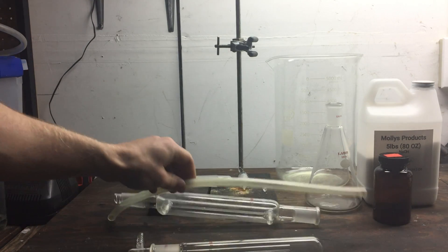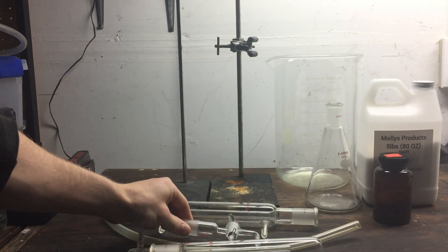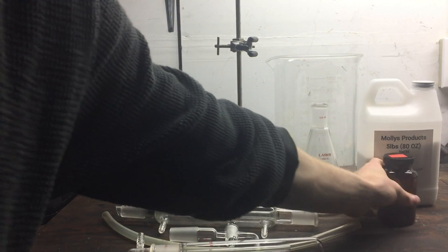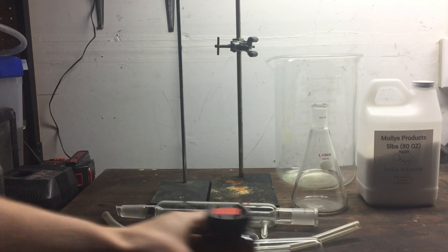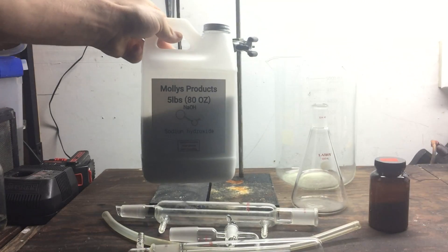I used some tubing to help transport the ammonia from the reaction flask, a vacuum adapter piece, and a 500 milliliter flask. I used ammonium sulfate, sodium hydroxide, and then my large beaker in the back.